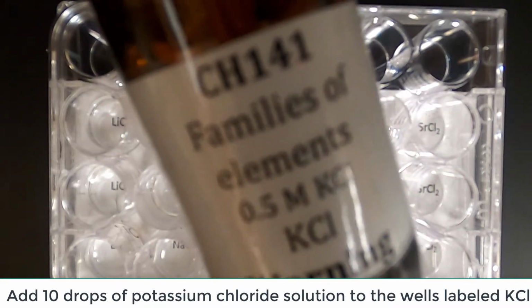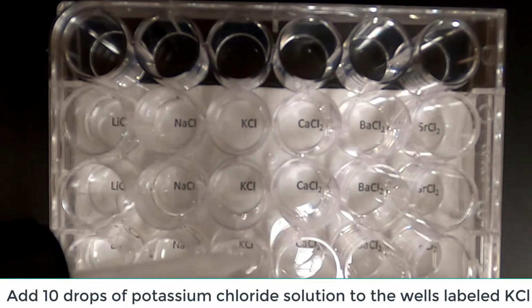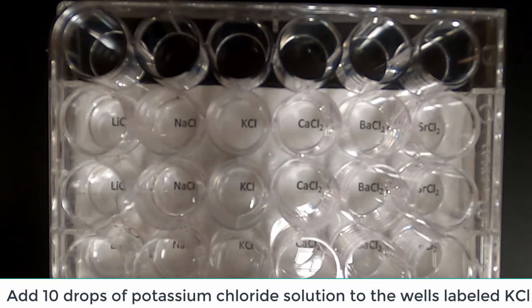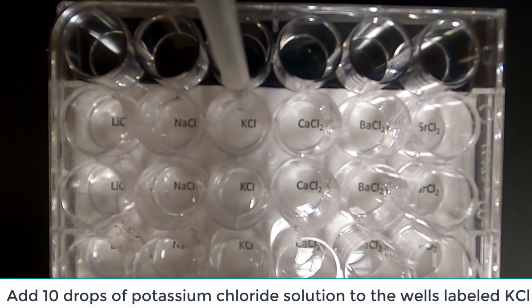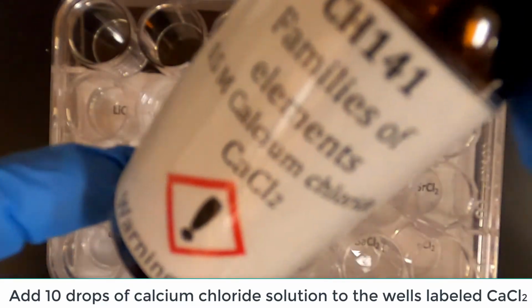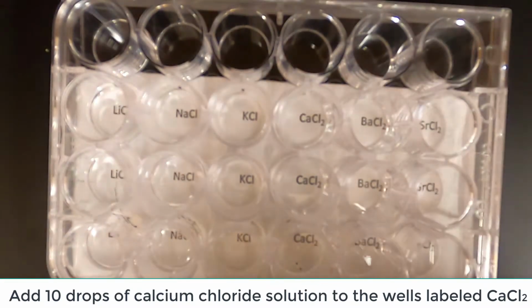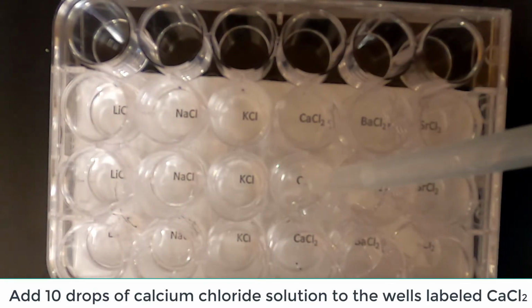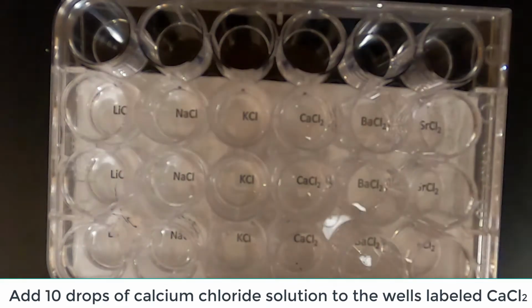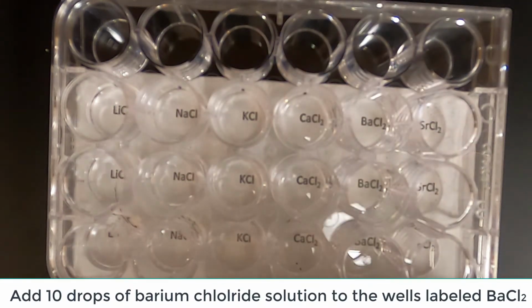Into each of the 3 wells labeled potassium chloride, add 10 drops of potassium chloride solution. Into each of the 3 wells labeled calcium chloride, add 10 drops of calcium chloride solution. Into each of the 3 wells labeled barium chloride, add 10 drops of barium chloride solution.